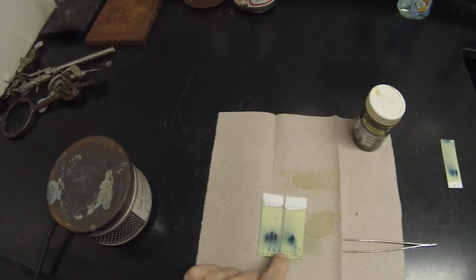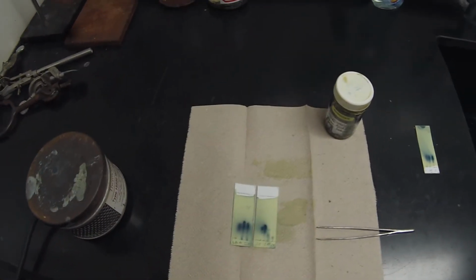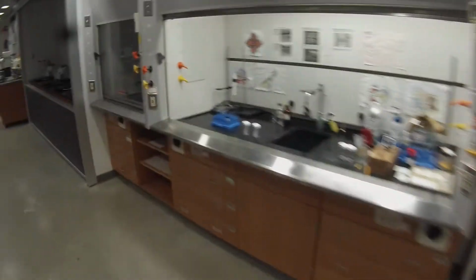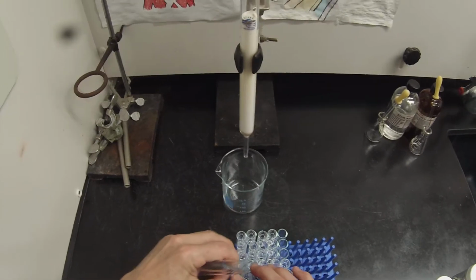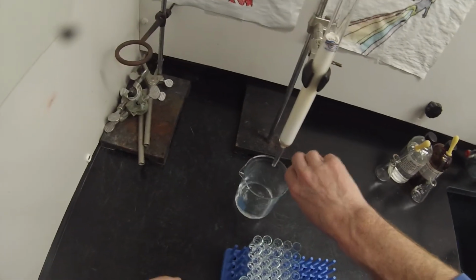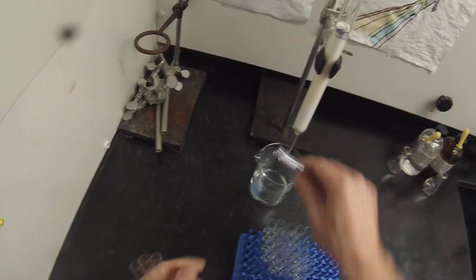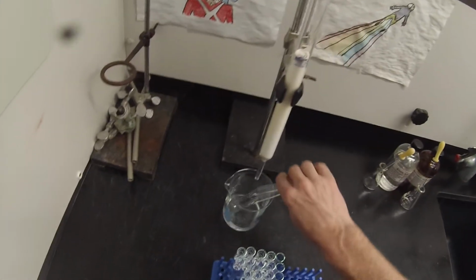And based on these plates I've already run, I know that I don't want any of the first 8 fractions. Even though 8 has some product, it's got that biphenyl in it, so I don't want it. And I know I don't want anything from 18 on, so I can dispose of everything below 8. So the first 5 fractions can be discarded. It's a whole lot easier to pour all your fractions into a beaker in your hood and then take them to the organic waste. So that's 6, 7, 8. Don't know if I want 9 yet. We'll find out soon.